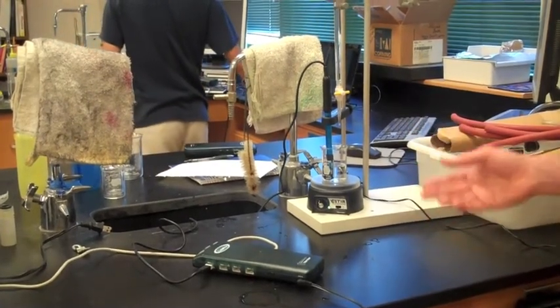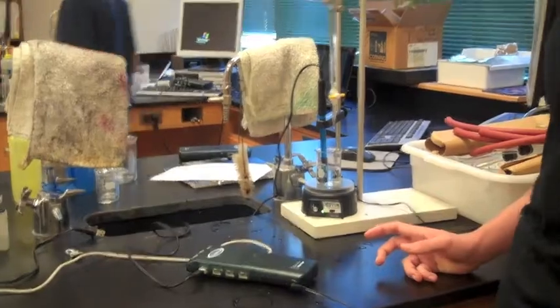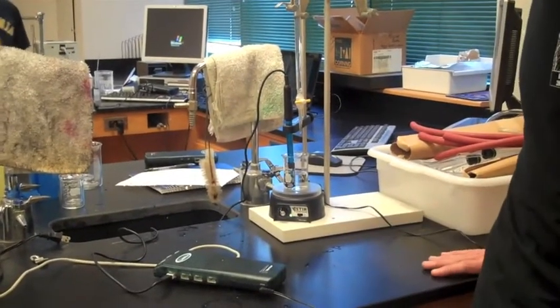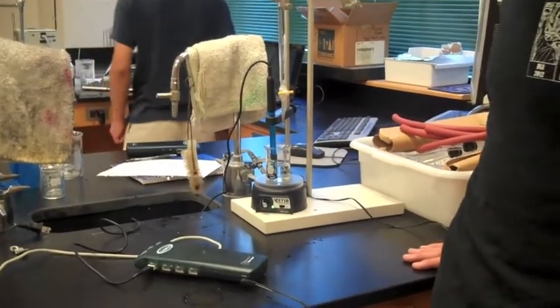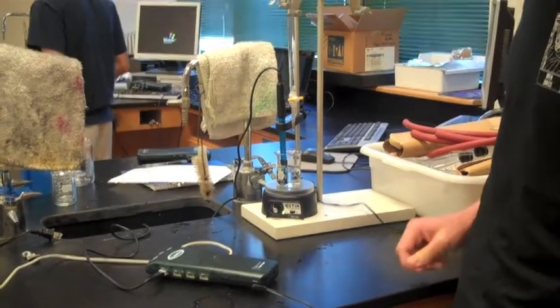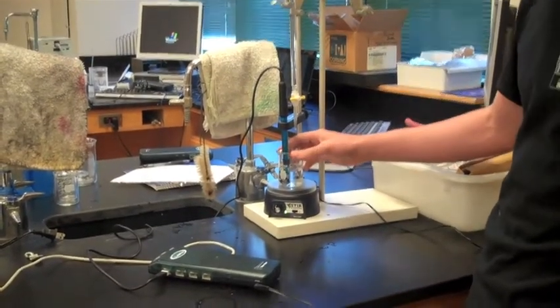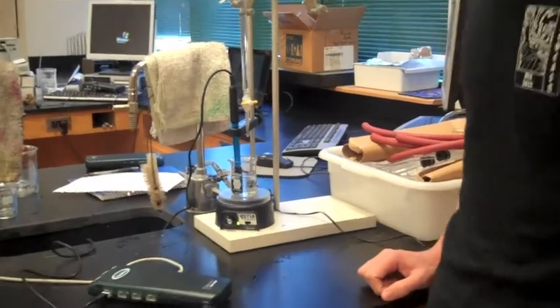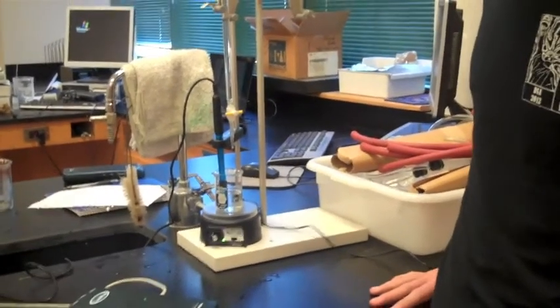In a minute I'm going to explain why this happens, but first I'm going to give you a quick demonstration. Here I have a solution of tenth molar sodium acetate and acetic acid solution, and a burette filled with hydrochloric acid.